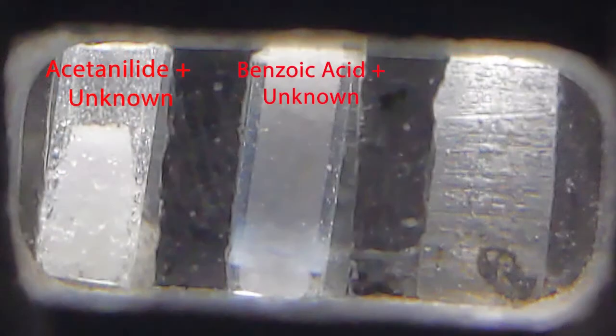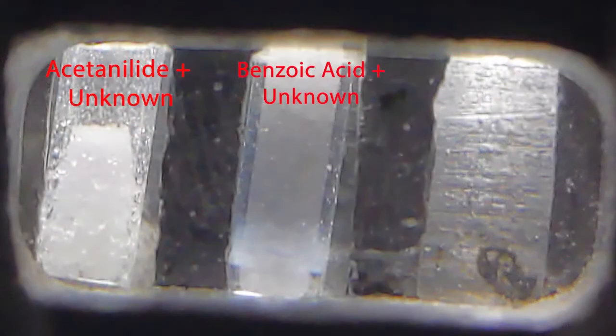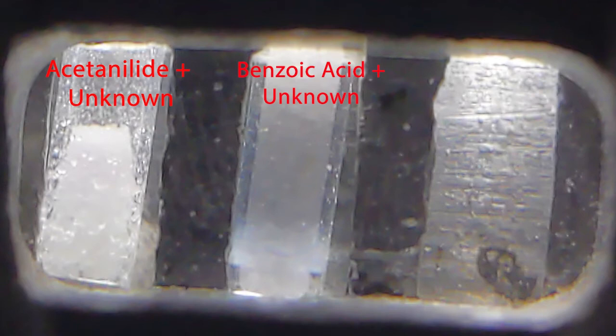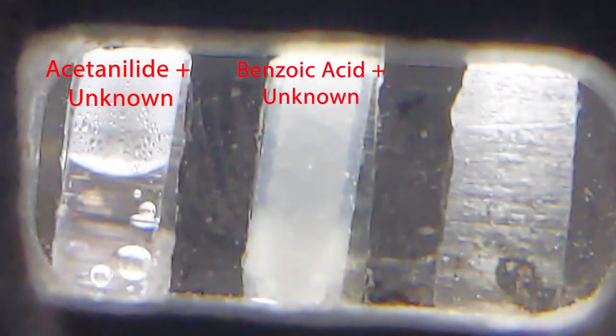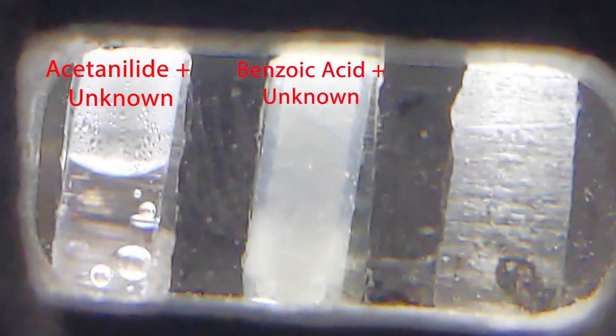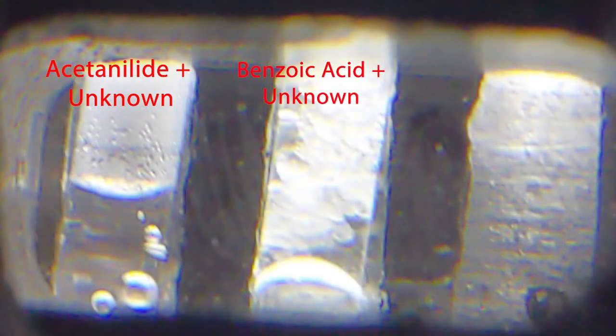The mixture of unknown and acetanilide yielded a melting range of 83 degrees centigrade to 112 degrees centigrade. The mixture of unknown and benzoic acid yielded a melting range of 122 degrees centigrade to 125 degrees centigrade.